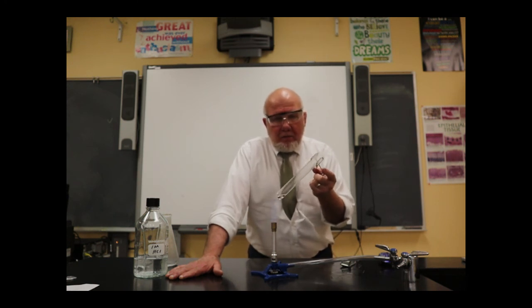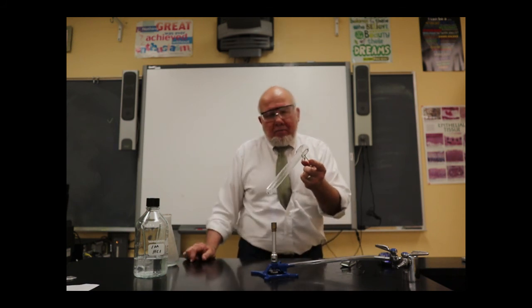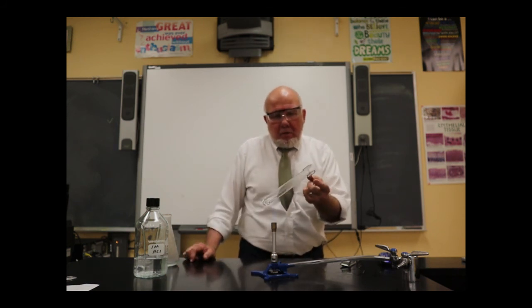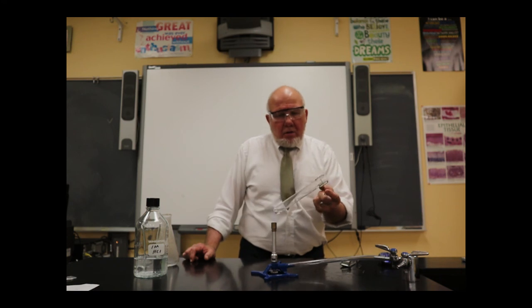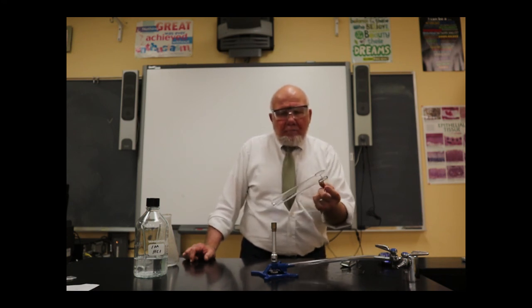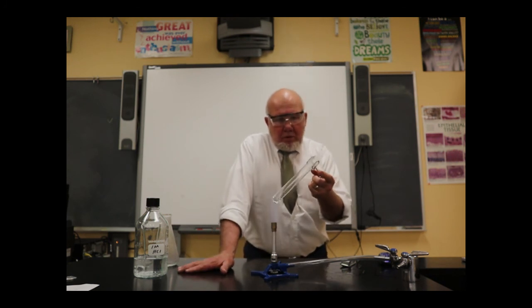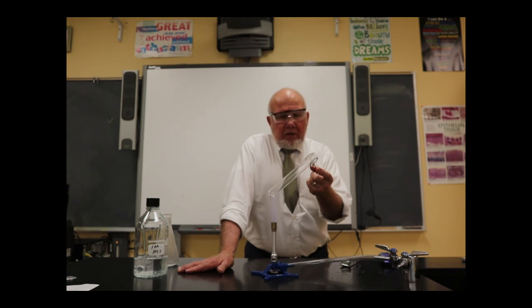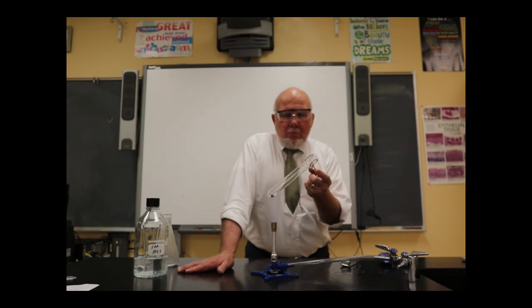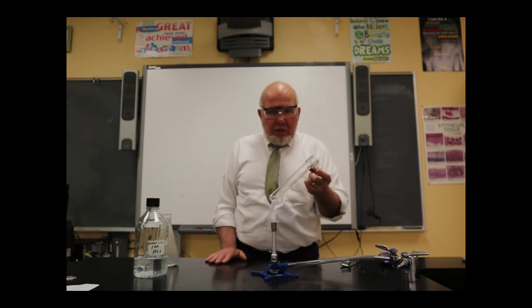I don't know if you can see quite yet, but there is some white residue showing up on the inside of the test tube. Kind of heat it up over here, drive off that water that's up there. Get the test tube nice and hot, as I want to evaporate off the liquid. And even when you have a little bit here, you've got to be aware to move it in and out of the flame. Don't let it build up too much.